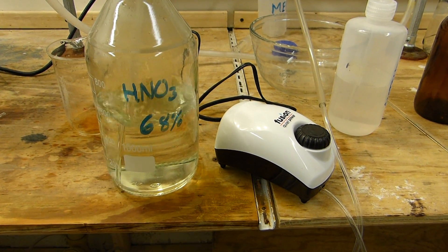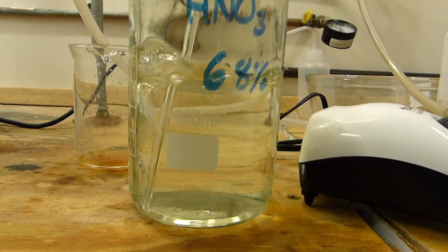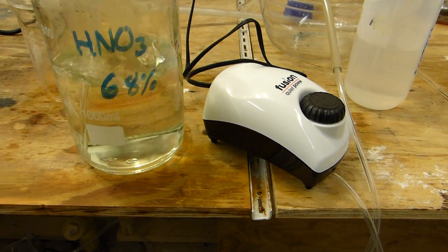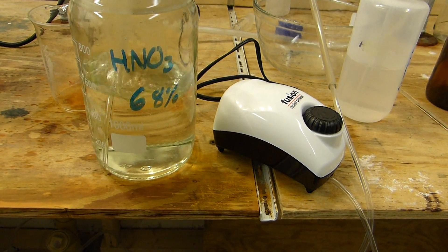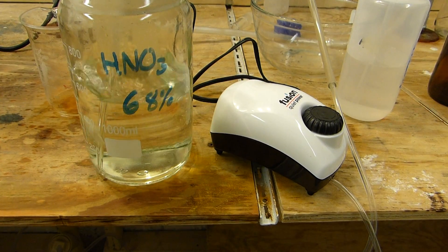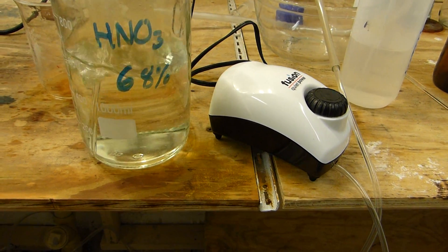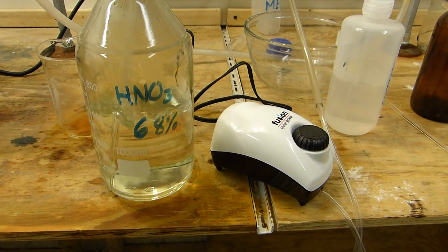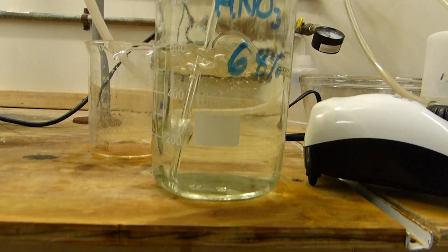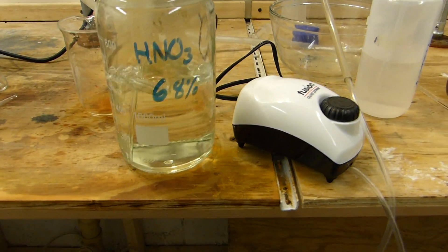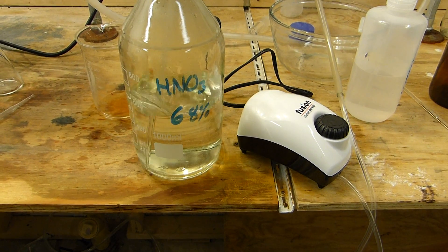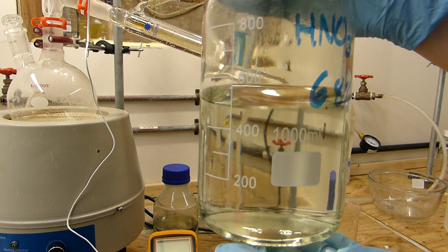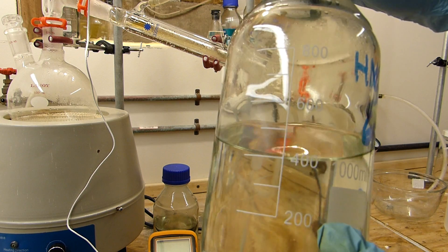So I've decided to try and remove some of the nitrogen oxides from my nitric acid, and you can see that I'm being fairly successful by sparging it with some air from a small fish tank bubbler here. All that's needed is about a minute or two of this. And just bear in mind that anything that you introduce into the air that's going into the nitric acid ends up in the nitric acid. So water, for instance, will dilute the concentration if you do this for a while. My nitric acid is just about water white now. So I'm just about done and this has only been going for about a minute, so I'm pleased with those results.